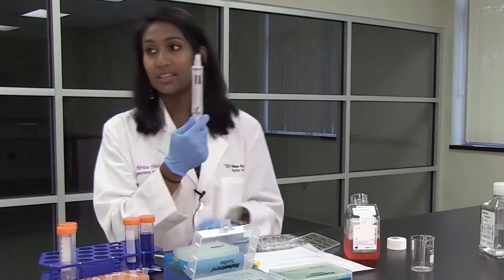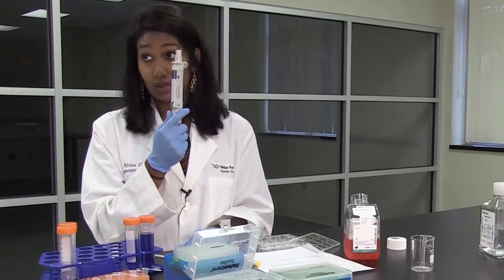So, on the P1000, this is what 800 microliters look like.